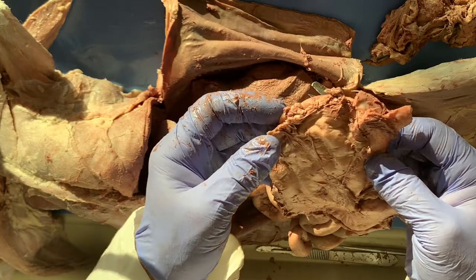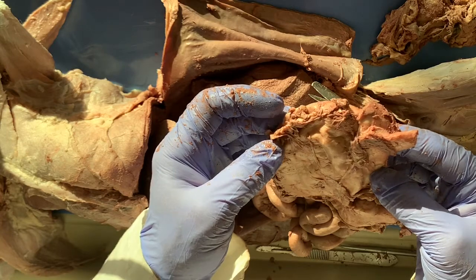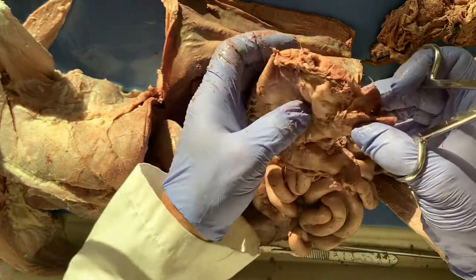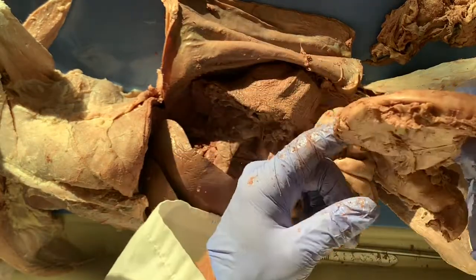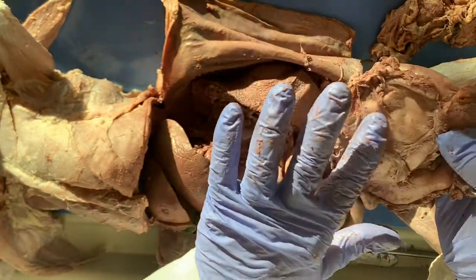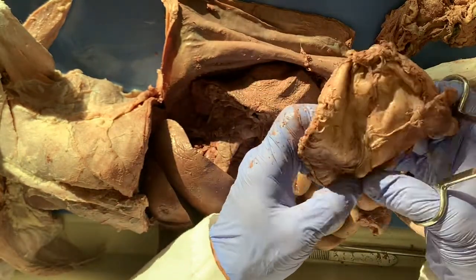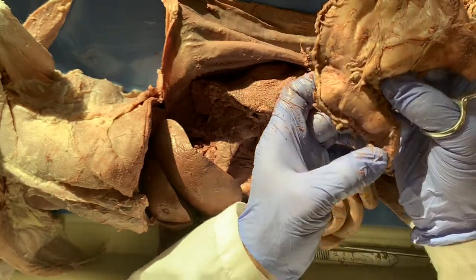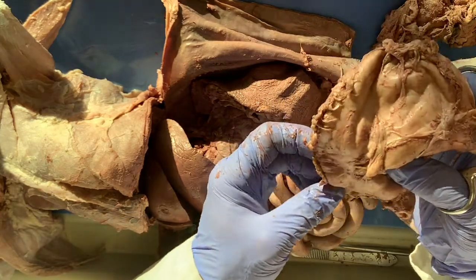Okay, so I'm going to stop the video here real quick, and we'll do a close-up of the stomach. Actually, while the camera's going, I'm just going to do what's called a butterfly cut. So I'm going to go all around the perimeter. You can see this is called the fundus, the upper part of the stomach. This is the body of the stomach. And then as it comes down here, we have the pylorus, which is like an antechamber. This is where the food collects before the pyloric sphincter opens up, and then the food exits the stomach into the small intestine, okay?